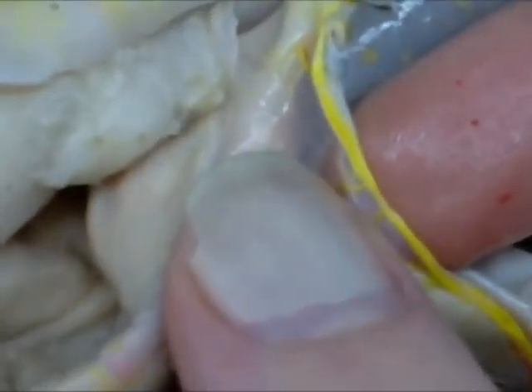We found our gastrosplenic artery — the red there — that comes this way. The posterior intestinal artery connects with the intestine. Here's the posterior splenic vein. And this is the anterior splenic vein here.